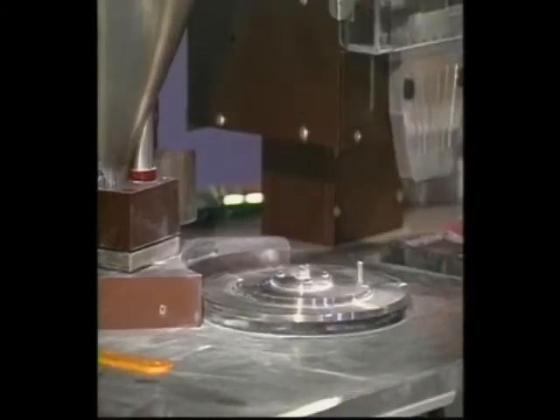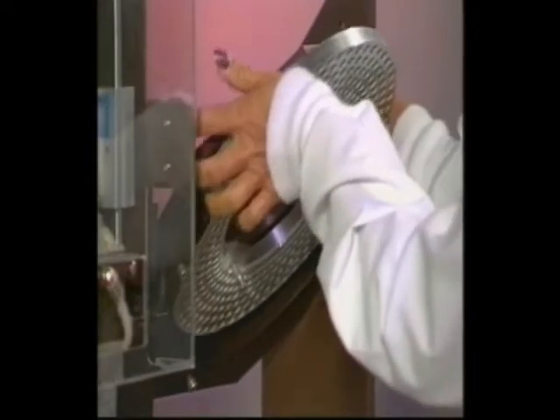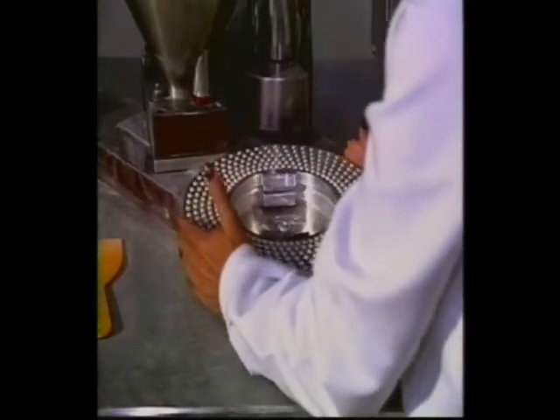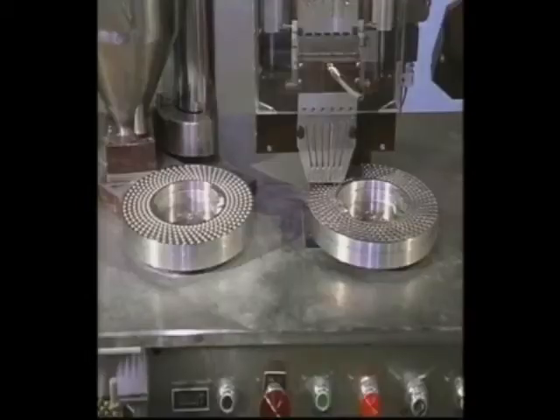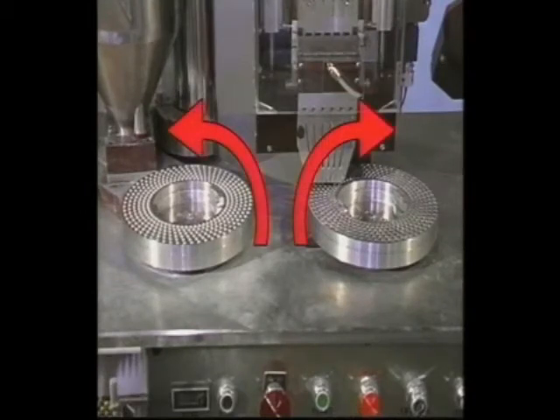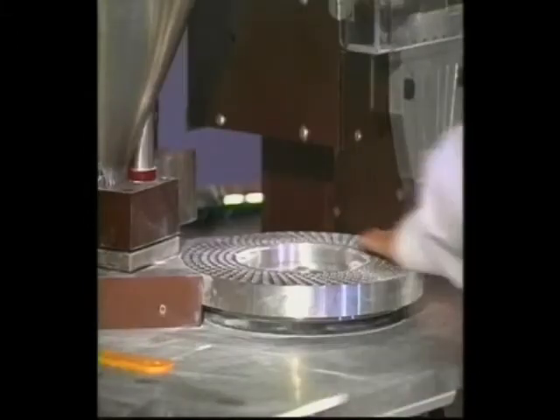Once the rectifier stops, separate the cap ring from the body ring. Place the cap ring in the easel provided — you will not need it again until you are ready to close the capsules. Make sure the body ring is seated correctly by gently turning it counterclockwise until it hits the guide pins on the fill table. Note that you turn the rectifier ring clockwise but the fill table ring counterclockwise to seat them correctly. Pass your hand around the top of the ring to make sure the bodies are seated completely inside the holes, as the filling shoe can break off any bodies that are sticking out.